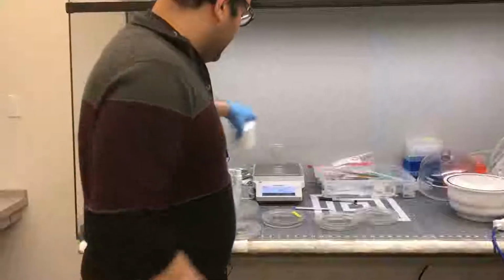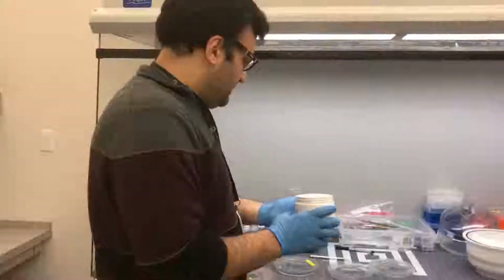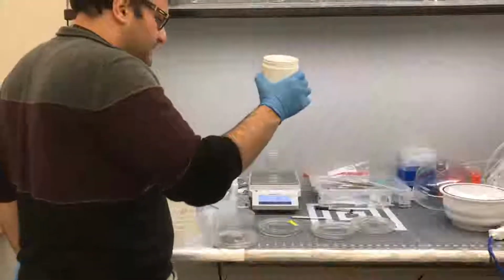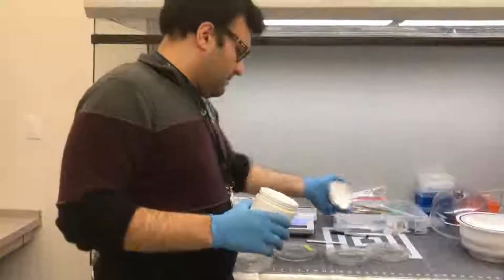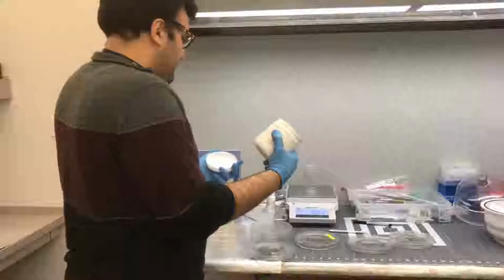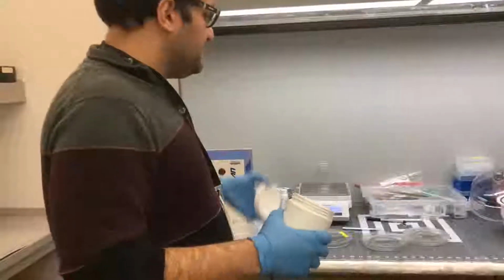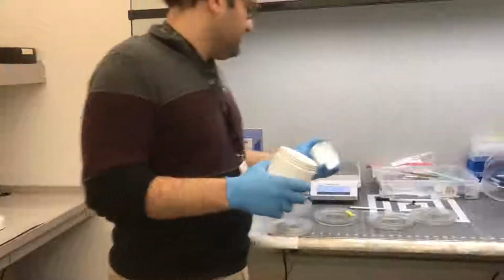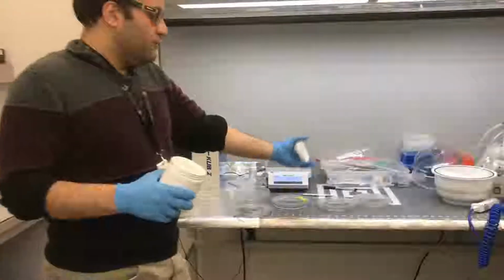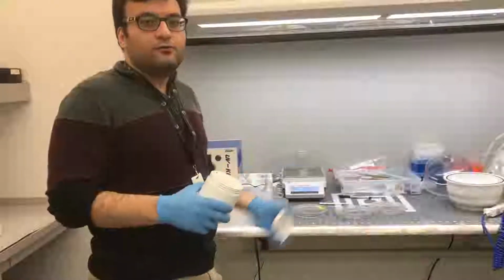And then we tare it, no? Yeah, we weigh it. We make it 0. Then we add, based on whatever you want, based on the chip and based on the size of your master mold, we add the PDMS with the curing agent. Again, based on your PDMS, based on your chip structure, it is different. For example, for this structure, polymer PA chip, we use it 10:1, but for other chip, we use it 5:1 or 15:1.